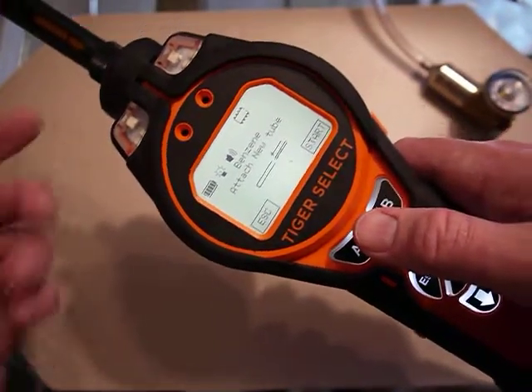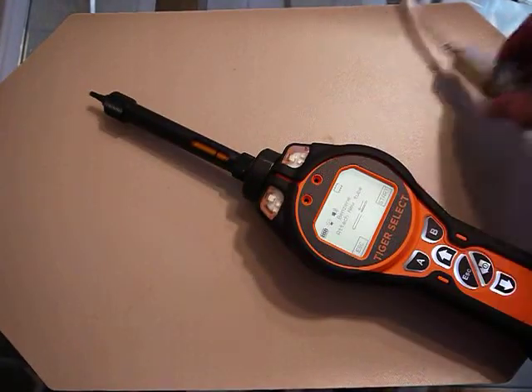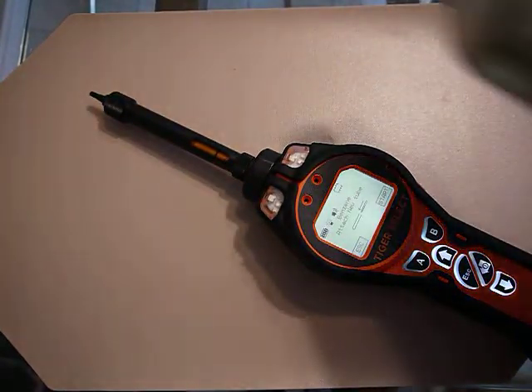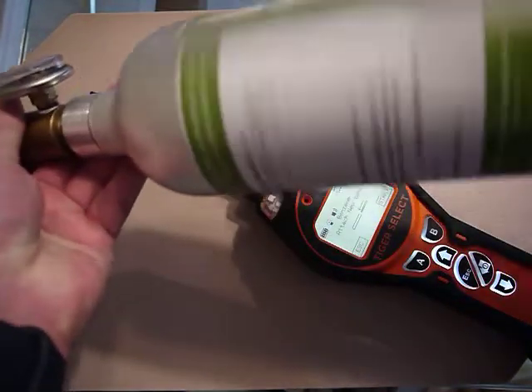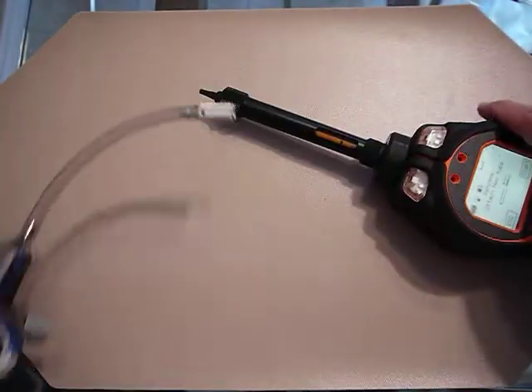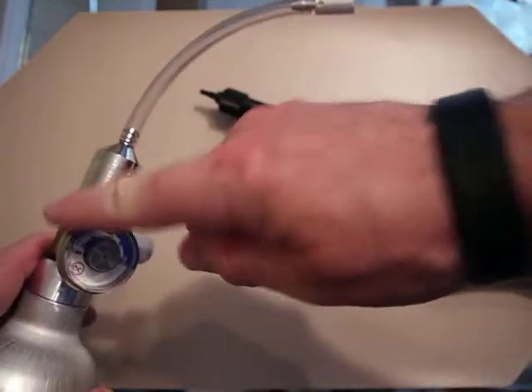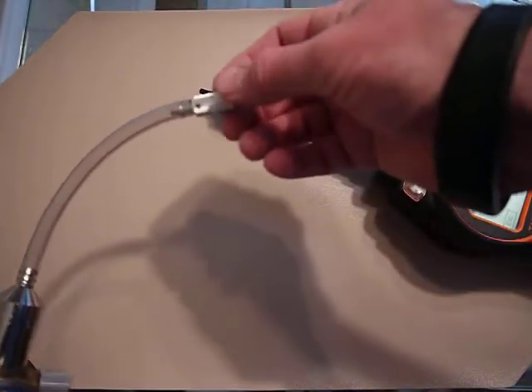I've already put in the tube so I'm ready. I'm going to use a cylinder of benzene to take a reading, so I'll put this on. I have a calibration adapter — the regular flow is 0.5 liters per minute coming through.